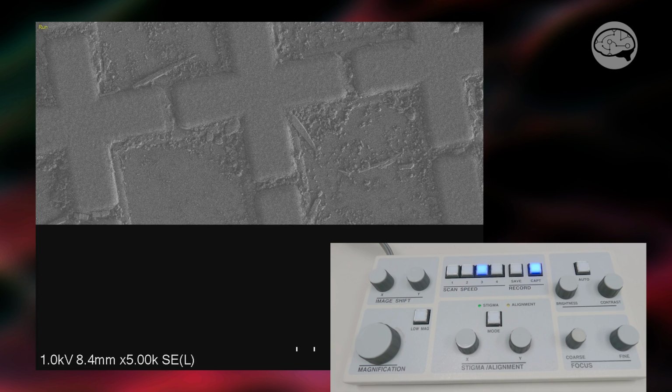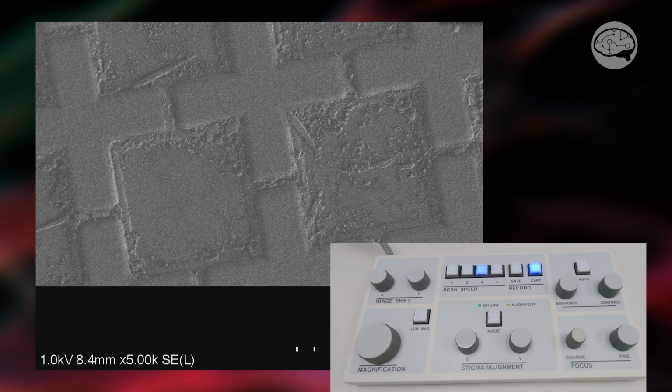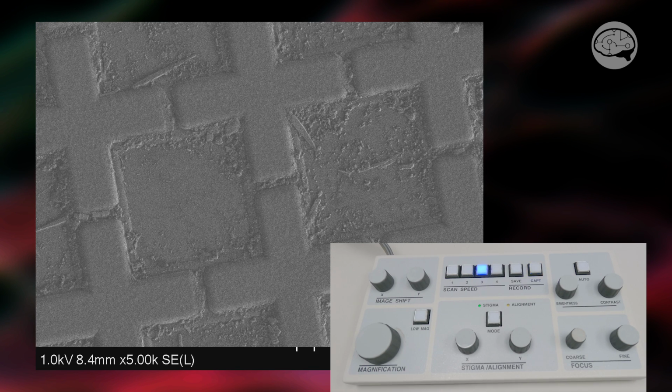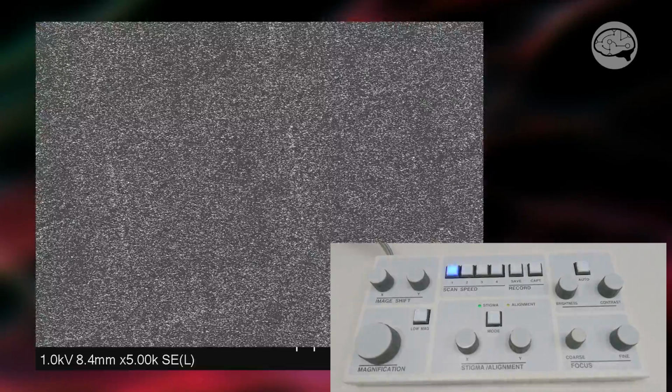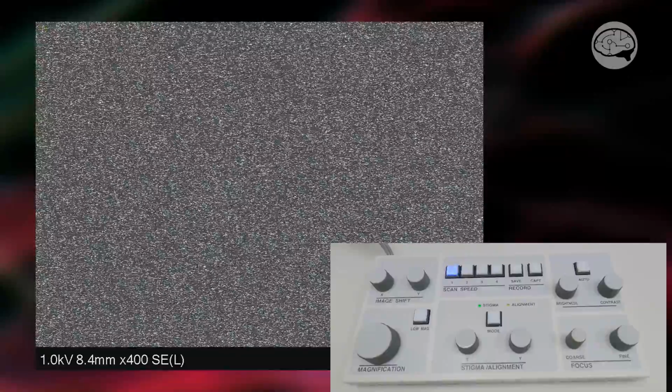And now we can go on to do other alignments like the aperture alignment. We can do the stigmators now, etc. This was quick and easy. Bam, that's how you do it. So here's our final captured image, which is a far cry from this crazy mess that we were trying to figure out initially. So sometimes you're just stuck with these super high noise images and you just have to learn these little tips and tricks to work around it.